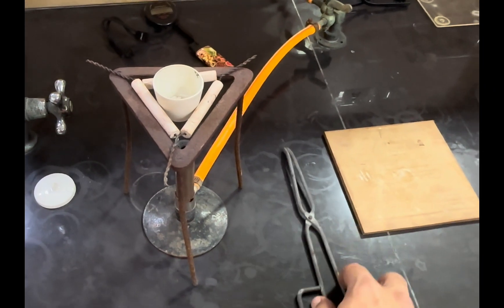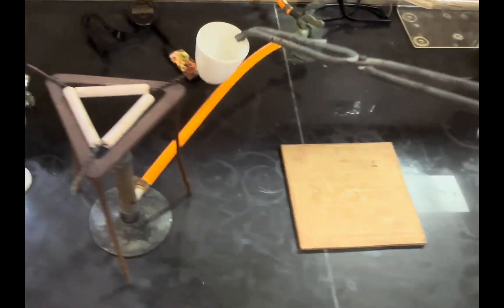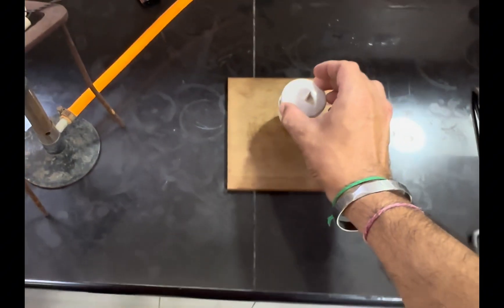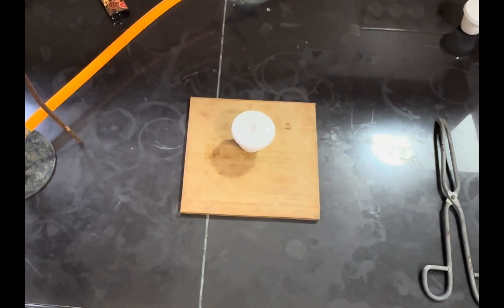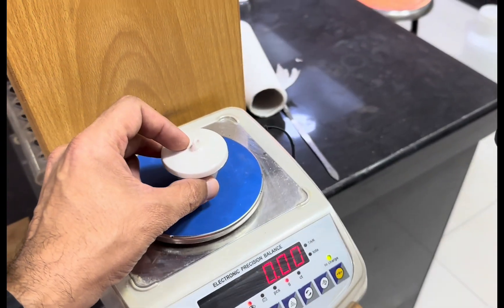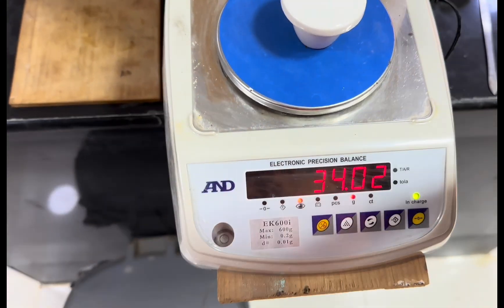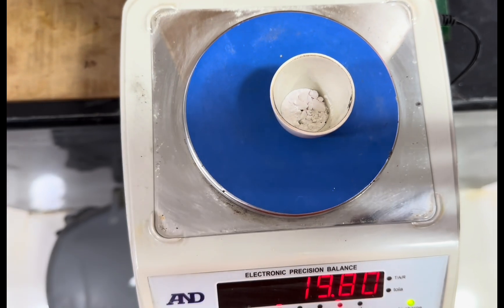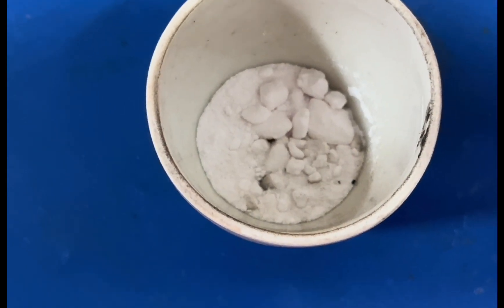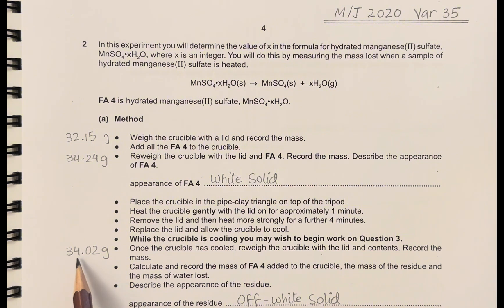Remove from heating and allow the crucible to cool. Use a pair of tongs to hold the crucible because it is hot, and keep it on a heatproof mat. Replace the lid and wait for it to cool down. Once the crucible and its contents are cool enough, re-weigh the contents. The mass is now 34.02 grams, and the appearance shows an off-white solid remaining at the end.